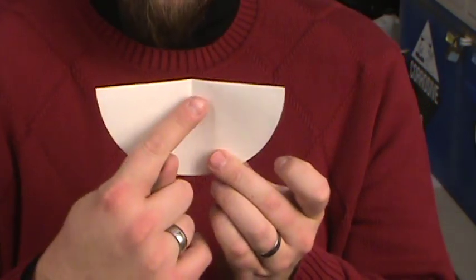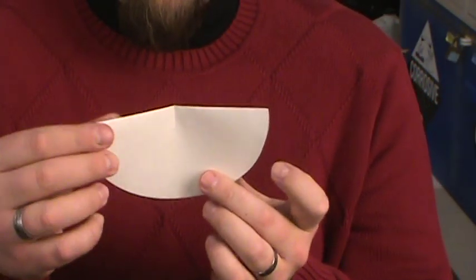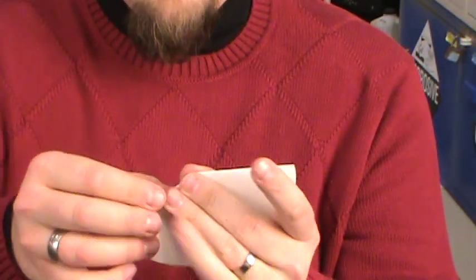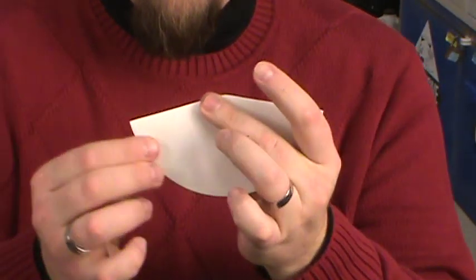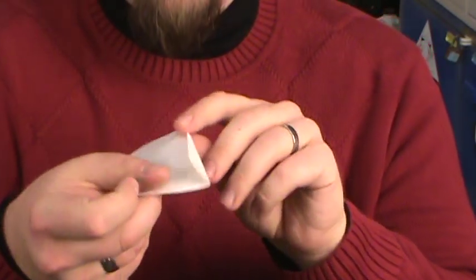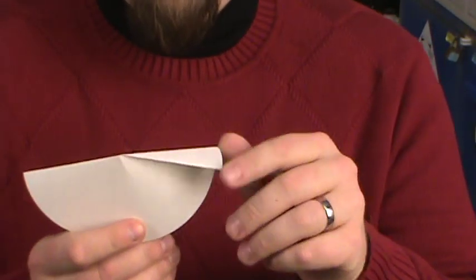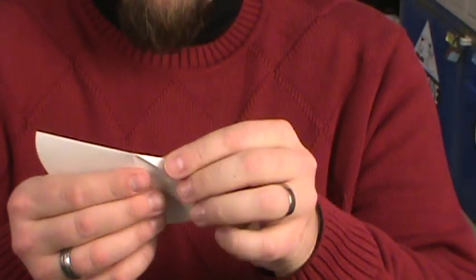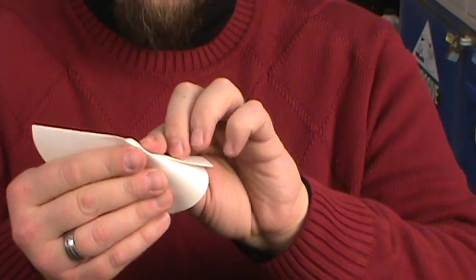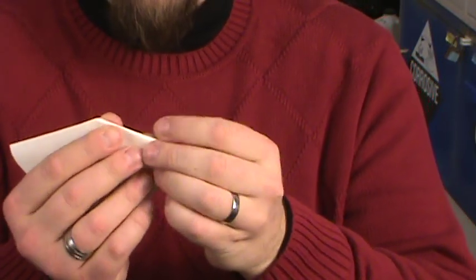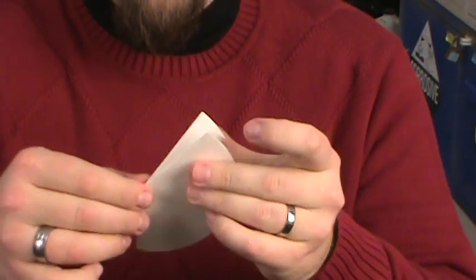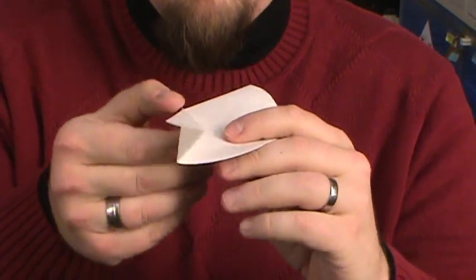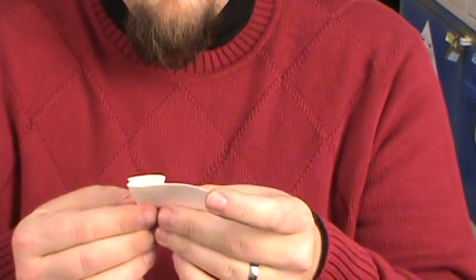To flute this, from that center point fold over a little bit of a flap, so you see I folded just a little bit of the flap. Now fold it again in the opposite direction. Pinch it down so you see I'm making a little bit of a z-fold there. Now for the easy part - keep doing that all the way across, just alternate back and forth.